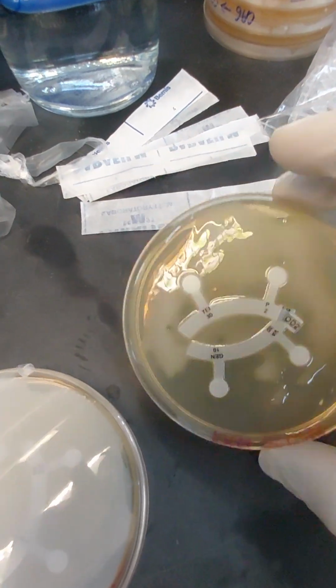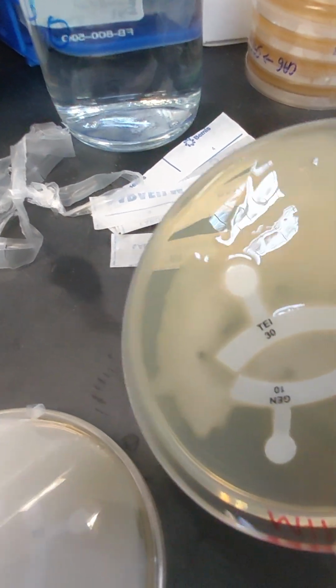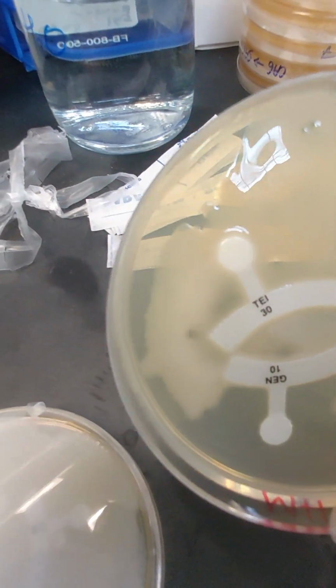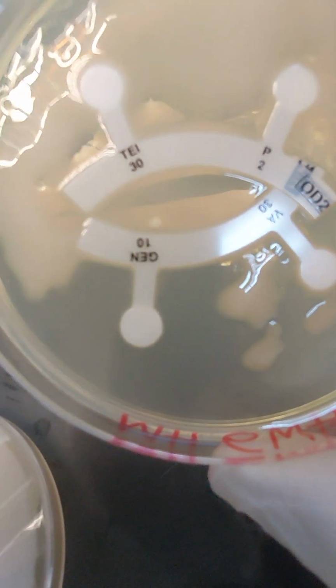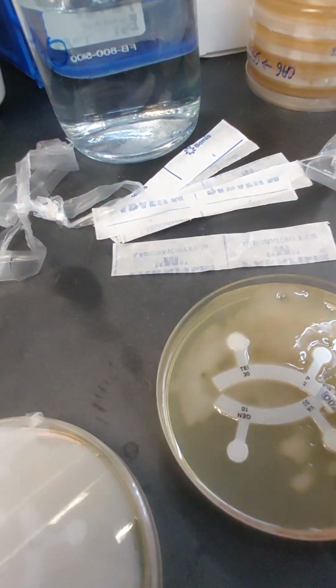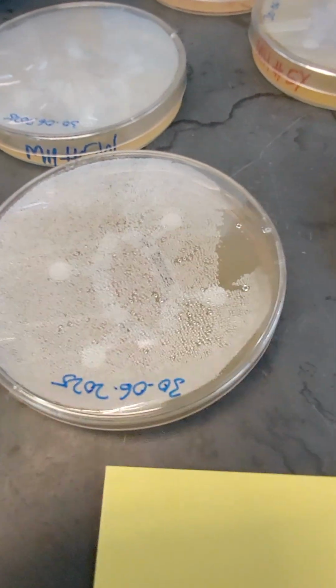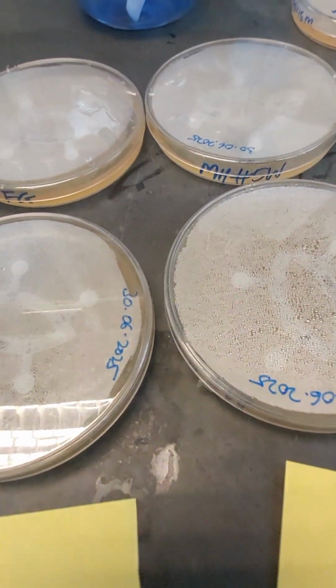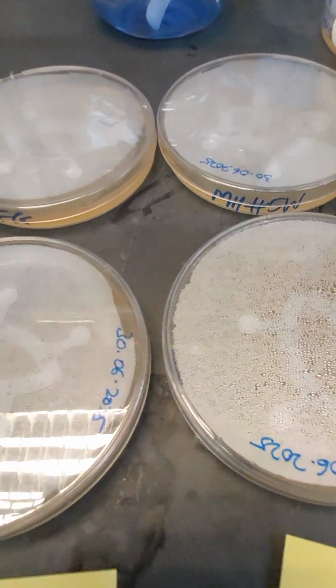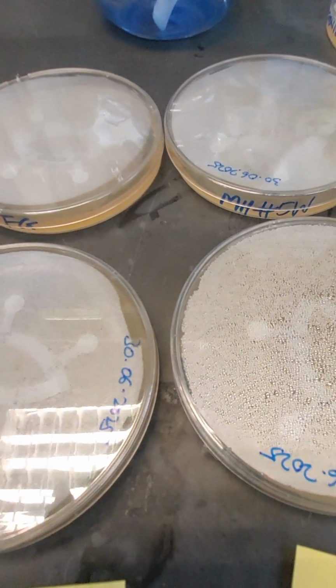Can you see that? So we'll discuss this later because it tells us some very interesting facts about that particular microbe. Again, 6WH on the next plate and the next set of antibiotics. Again, you can see some kind of inhibition but not much. For example, gentamicin definitely is inhibiting the growth. It's a very strong antibiotic. The remaining, not much. So based on the resistance profiles, we can learn a lot about these particular bacteria and the pathways which they have in their genomes and the mechanisms whereby they resist antibiotics.